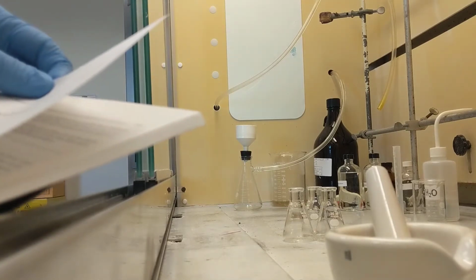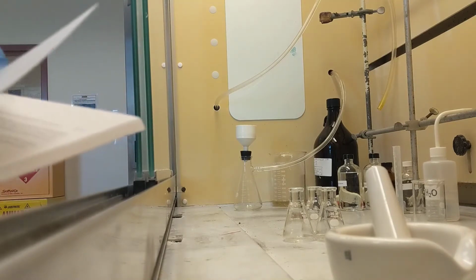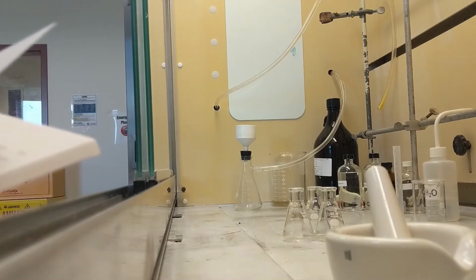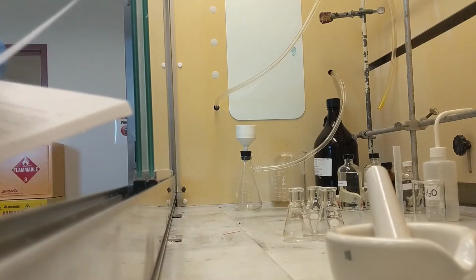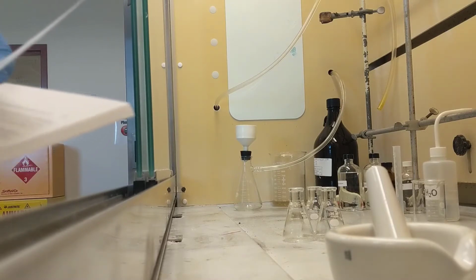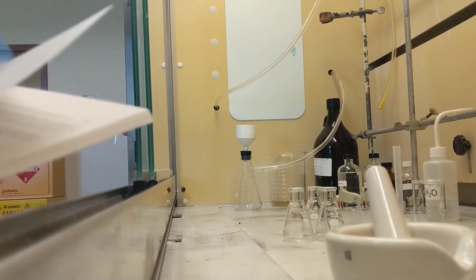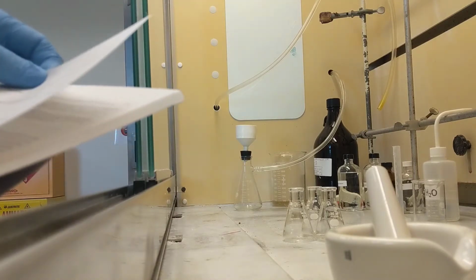In this experiment, you will extract, or I will extract, the chlorophyll and carotenoid pigments from spinach leaves using acetone as a solvent. The pigments will be separated by column chromatography using alumina as the adsorbent. Increasingly polar solvents will be used to elute the various compounds from the column. The colored fractions collected should be analyzed using thin layer chromatography. You should be able to identify most of the pigments already discussed on your thin layer plates after development.